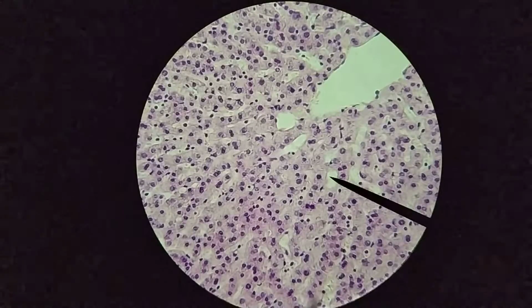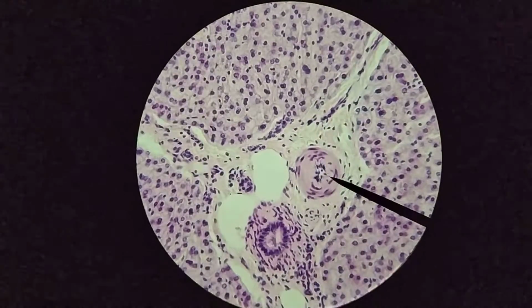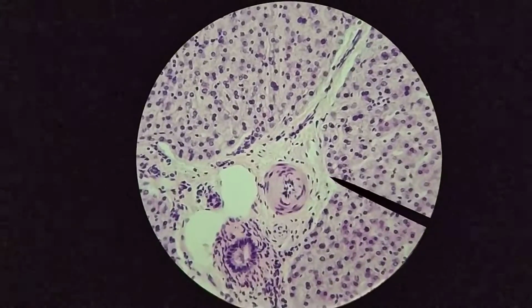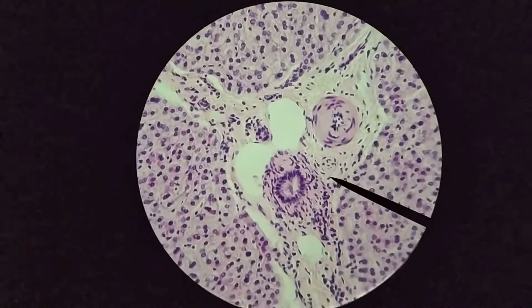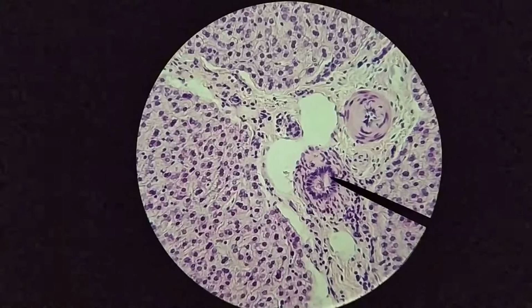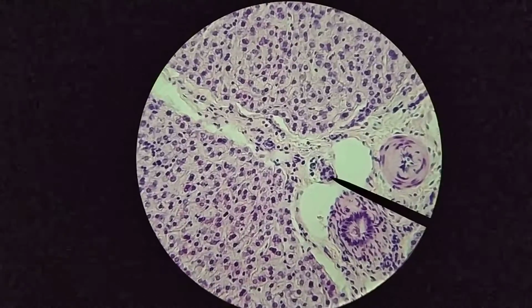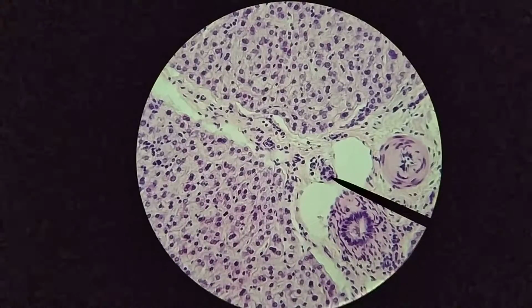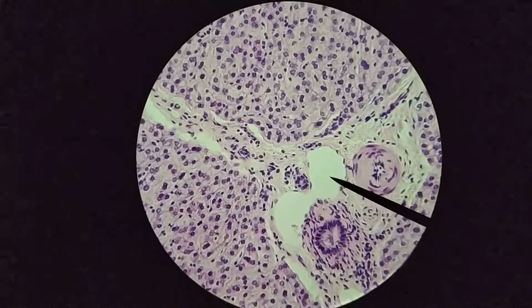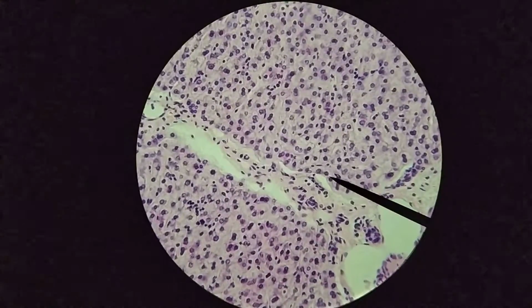Okay, so again, main structures or main things to notice: hepatocytes, sinusoids, central vein, and then again, here is an arterial or a small artery, very small lumen, fairly thick amount of muscle here. There is a bile duct. The epithelium here is actually starting to look a little bit more columnar, simple columnar. Here's a smaller bile duct over here, which is more simple cuboidal. And again, this is likely to be a vein over here, lumen of a vein. There's a smaller vein over here.